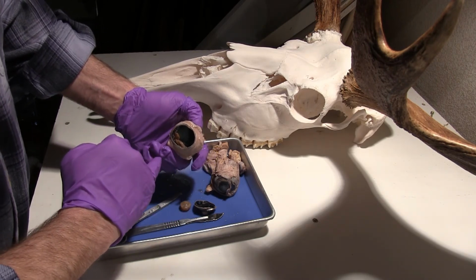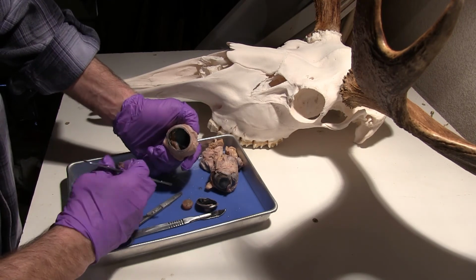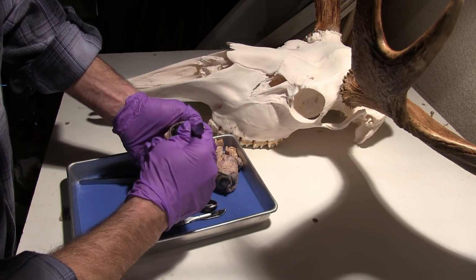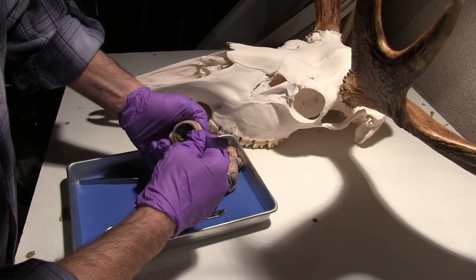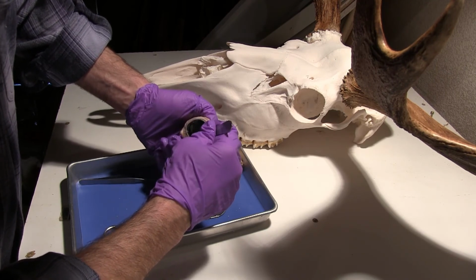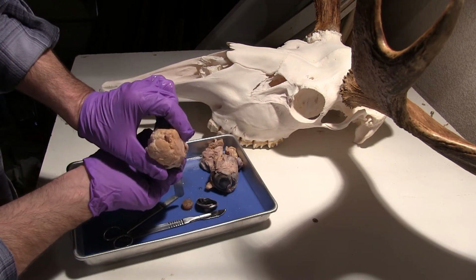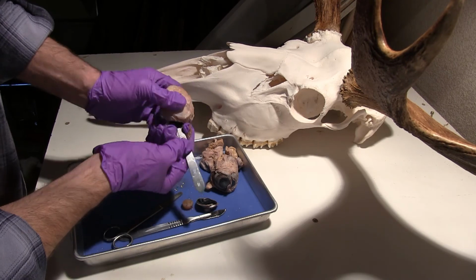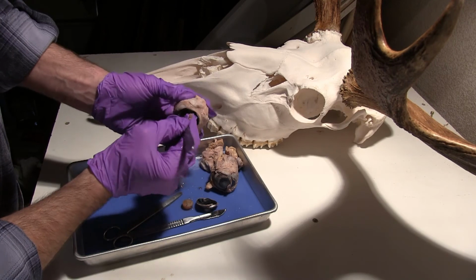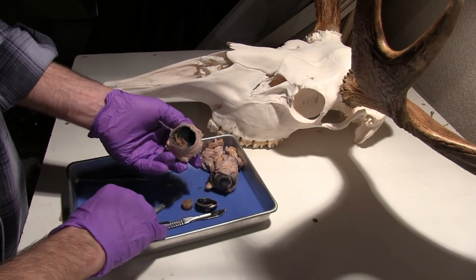Now, what I actually did there was I moved away this layer right here. So, while we have this intact, I'm going to see where the area is that it actually is connected, and right back there, when I look on the posterior side, you can see that's what connects to the optic disc. So that optic disc is going to be connecting to the optic nerve back here. So that would be the area inside the eye that we think of as the blind spot.